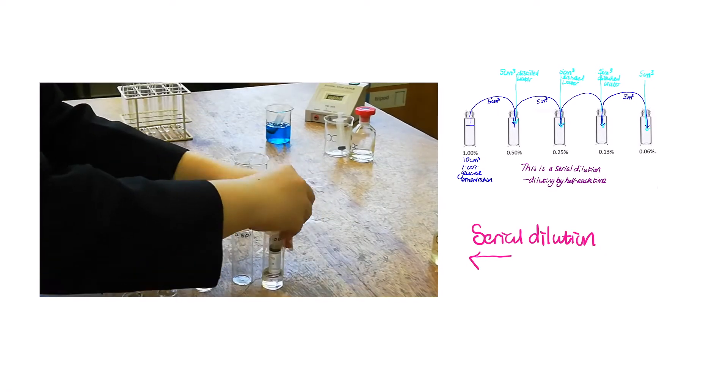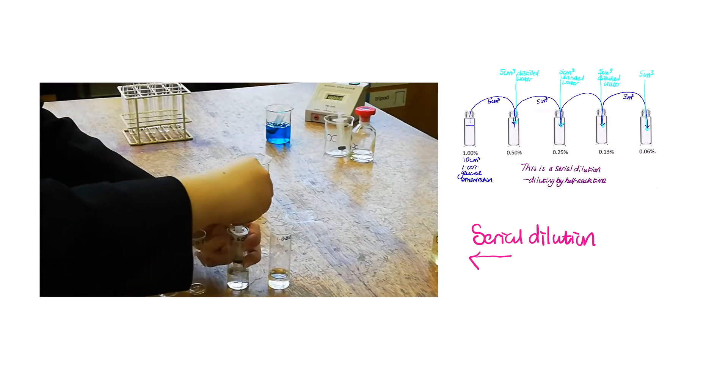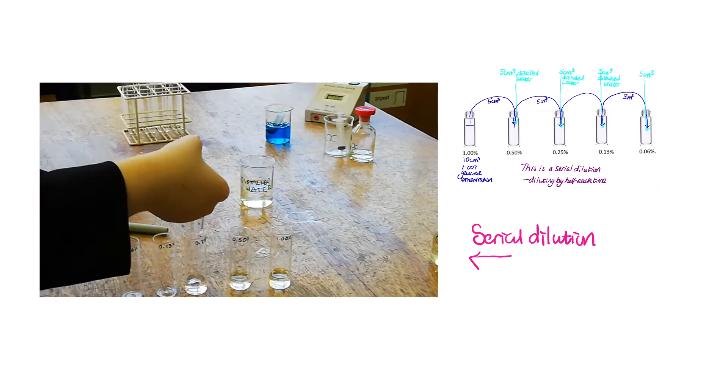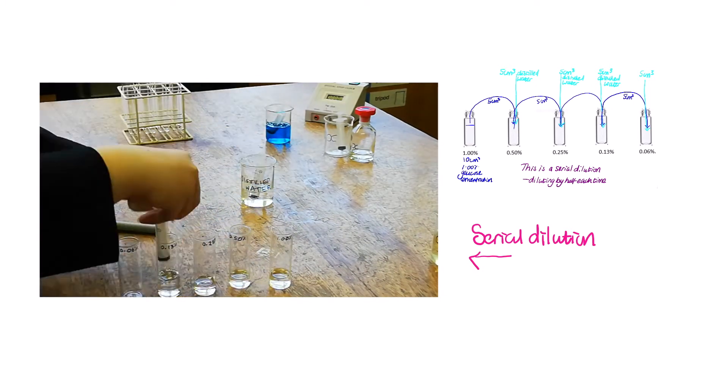So here you can see the serial dilution being carried out. Make sure you use different syringes for the water and the solution and ensure your tubes are labeled.